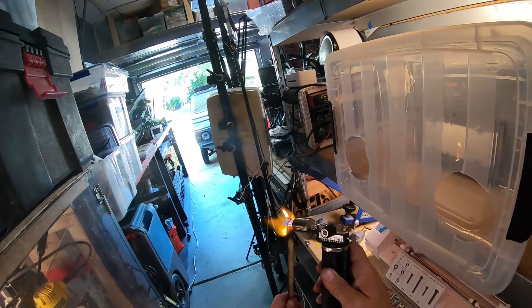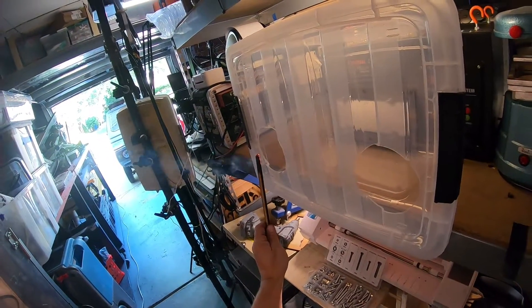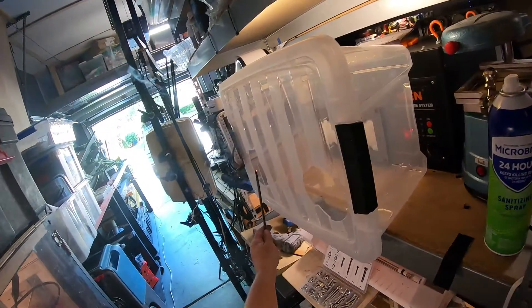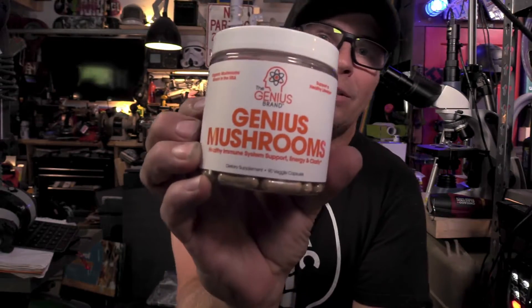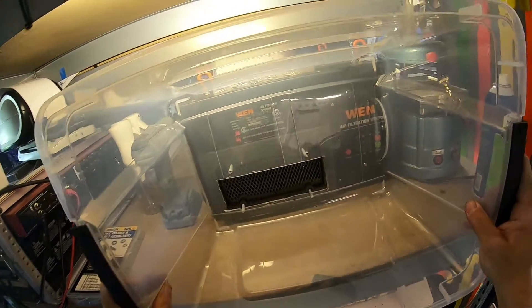Basically what we're going to be making today is what they call a laminar flow hood. It's used in mycology to create a very sterile environment. If you're interested in growing or studying mycology or growing mushrooms inside of your house, these are the ones I've been taking that I've been having quite good success with, except they're very expensive. So I want to grow mushrooms inside of the Hack Lab.